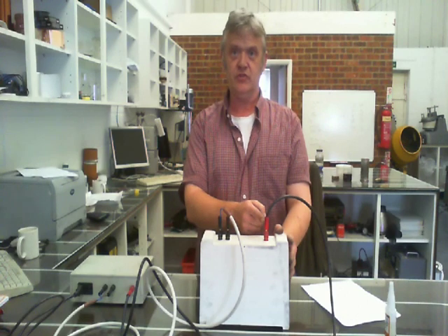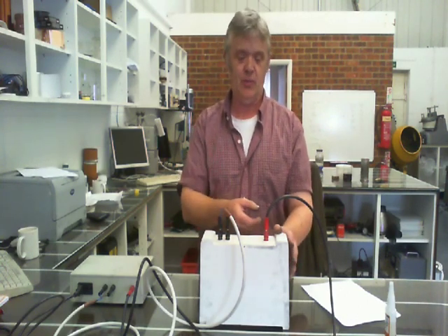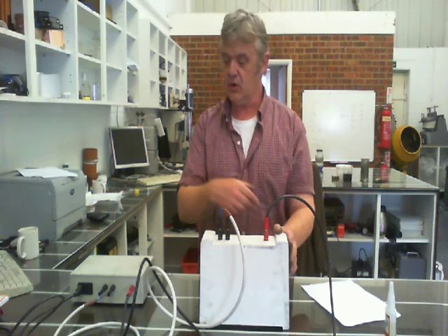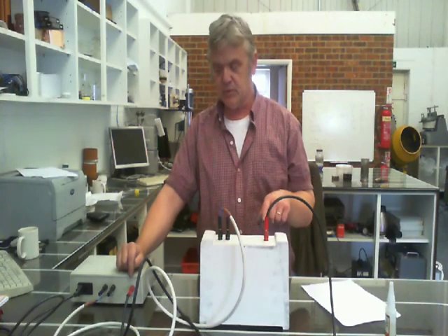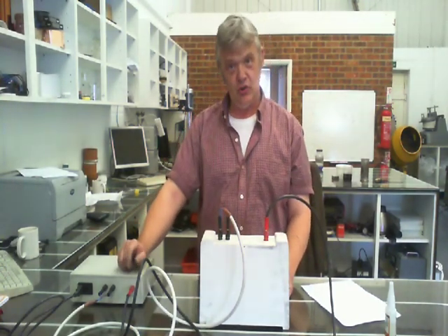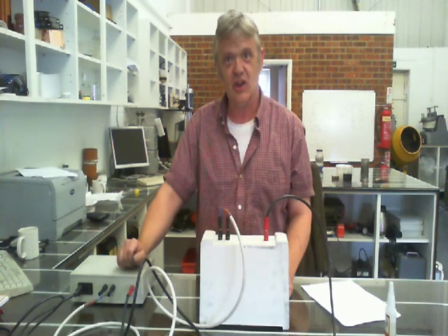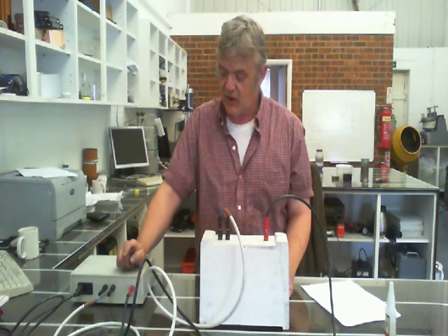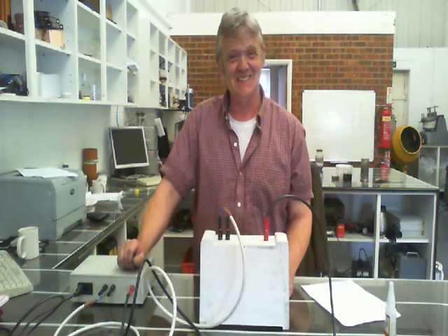We've got our high voltage cable, and I bought this high voltage cable from eBay, incidentally, it's a proper high voltage cable, and put it into a red banana plug. And obviously I've got a red banana plug at the other end to plug into here. Now because these are banana plugs, they stick out a little bit. So when it's actually turned on, you need to just be a little bit careful not to get anything too close to there, because there's obviously high voltage in there. You need to deal with that when it's turned off. Well, you only make that mistake once, I can assure you.